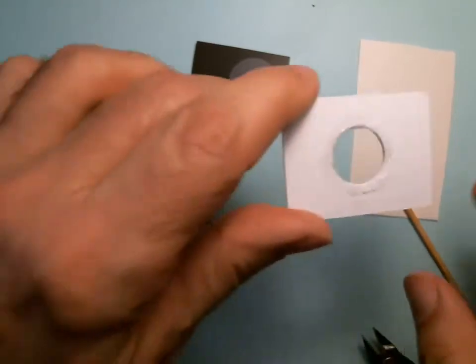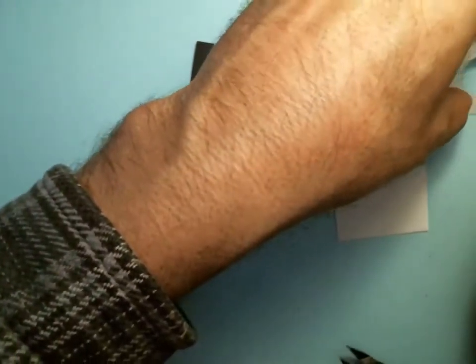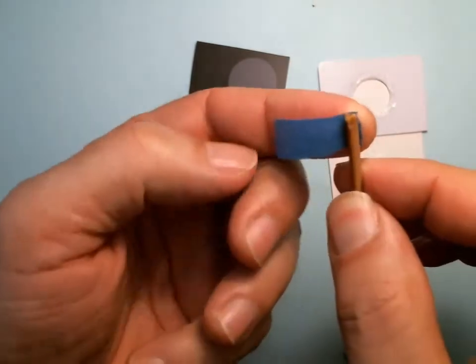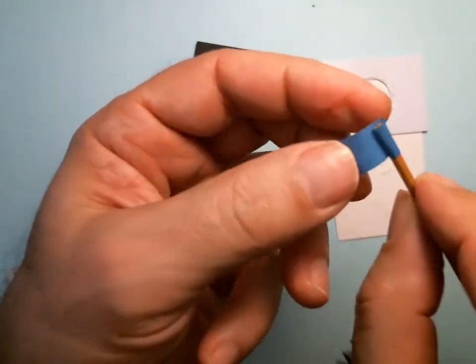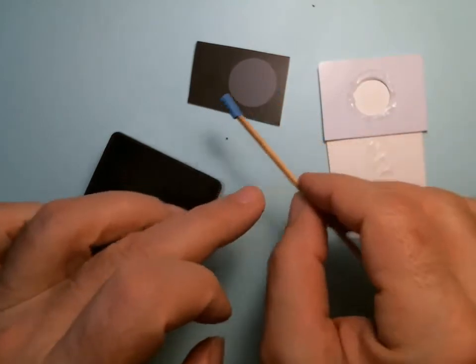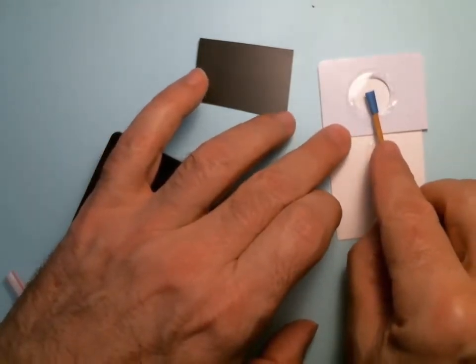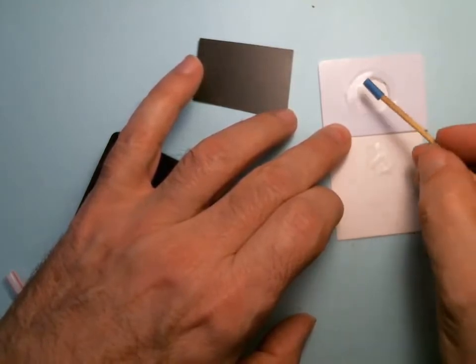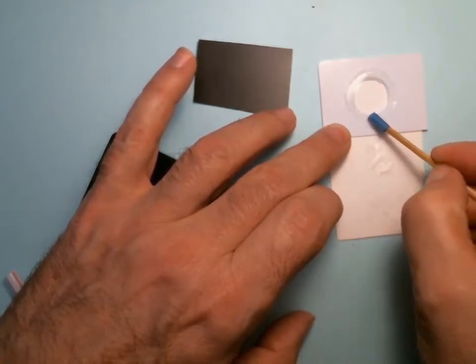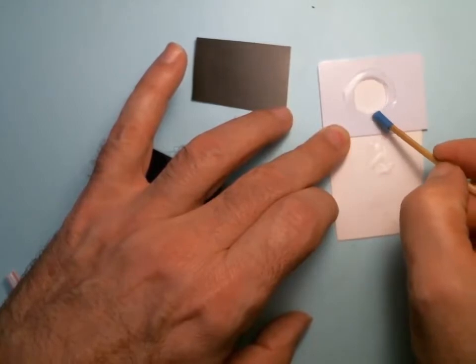Here's a trick: I'm going to put the glass down on the clean part of the paper. I'll take the clean part of the stick and wrap some blue tape around it — one rotation, then run it backwards — so now this whole part is sticky. I'm going to use that to pick up the glass and drop it right in the center. Then I'm just going to gently press down the edges to make sure all of the glue and all of the air is pushed out.